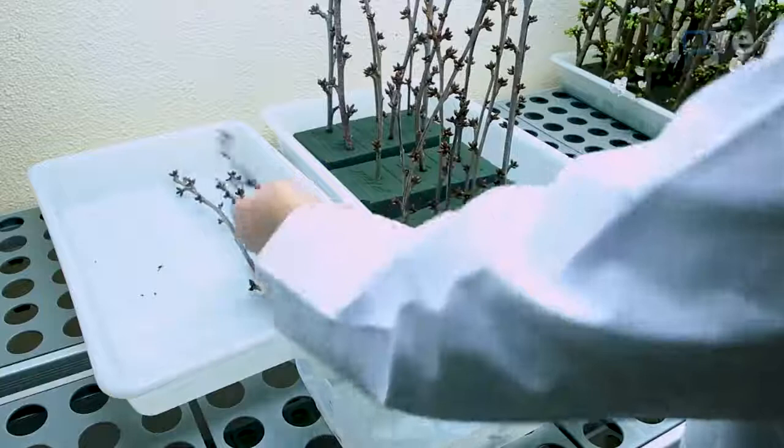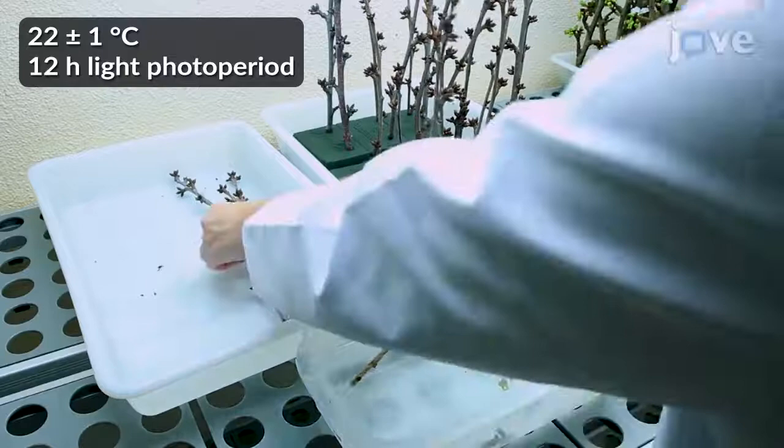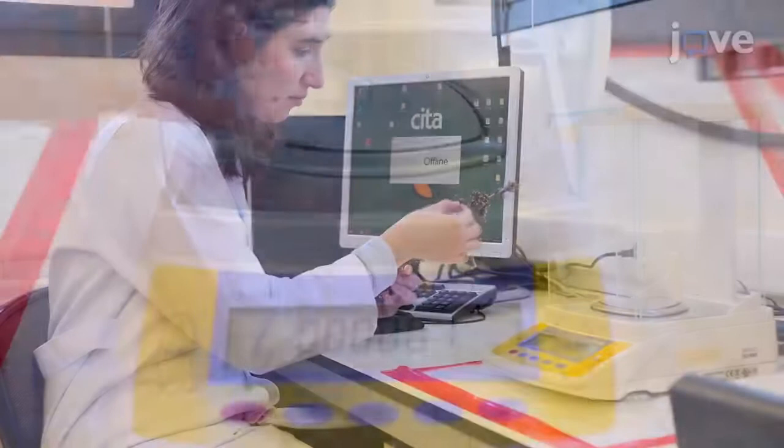Then, place the shoots on water-soaked florist foam in a growth chamber. After 10 days in the growth chamber, remove the flower buds from the shoots and weigh them.